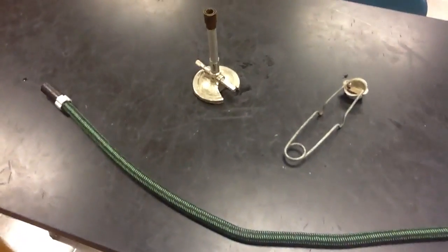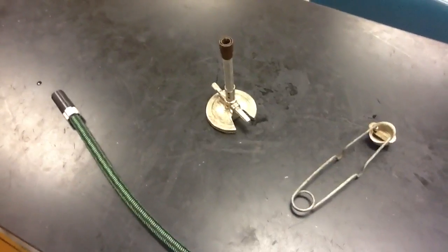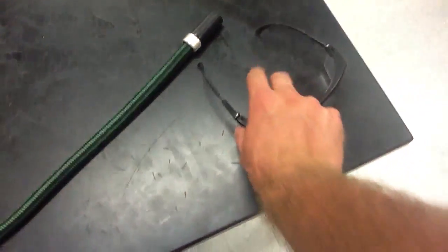Hello 7th graders. Today we're going to light the Bunsen burner and learn how to do that safely. The first thing is safety, of course, so you're going to want to put on your safety glasses.